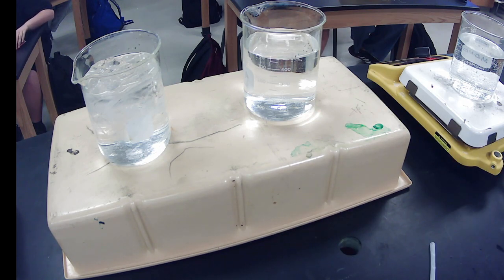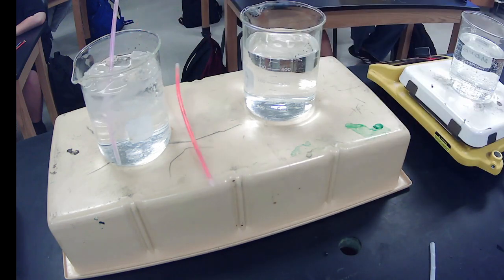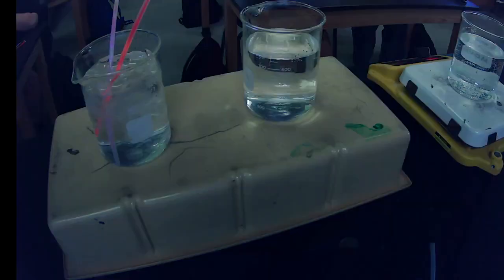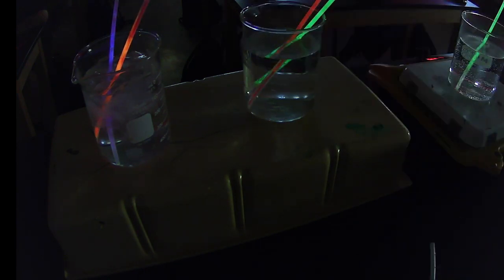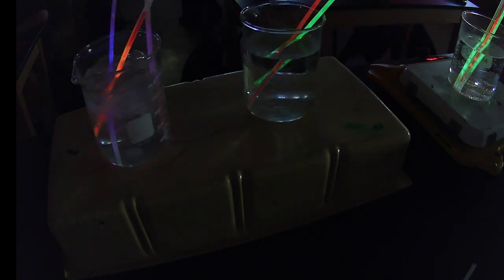Hopefully they're all working. That's the plastic.